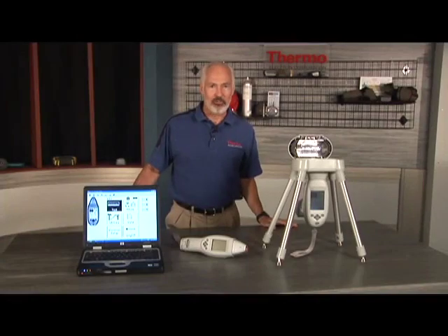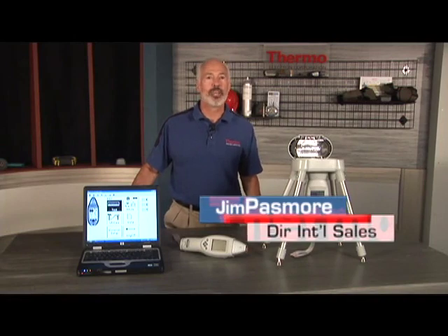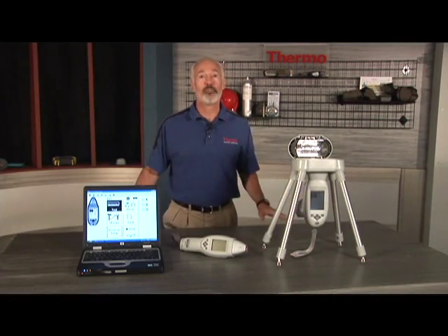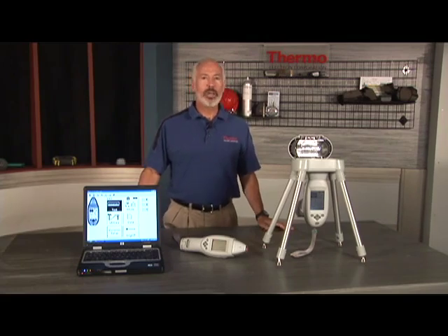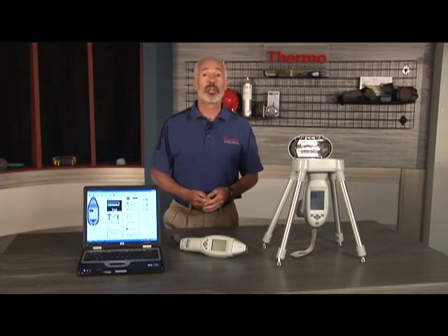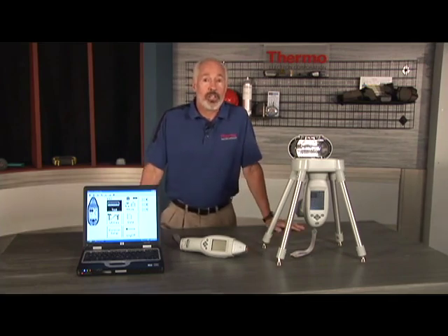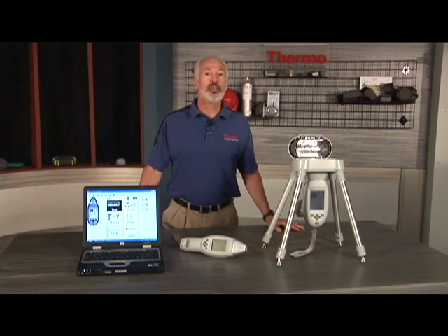Welcome to Module 3. In this module, we're going to use the instrument for testing unknown samples, just as you will for your application. Although we cannot practically expect to demonstrate every type of sample you may encounter, we will measure several typical examples of samples that represent the most popular applications. The measurement procedures and evaluation of results will be similar, even if your particular samples may be quite different.